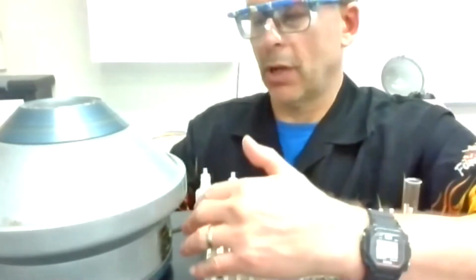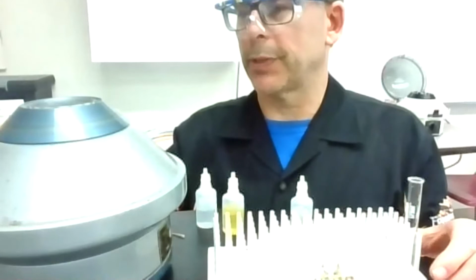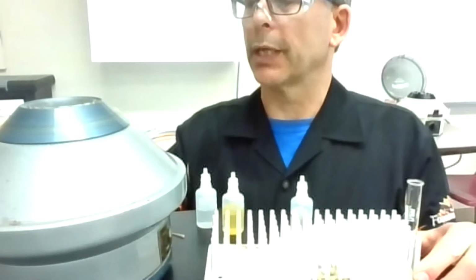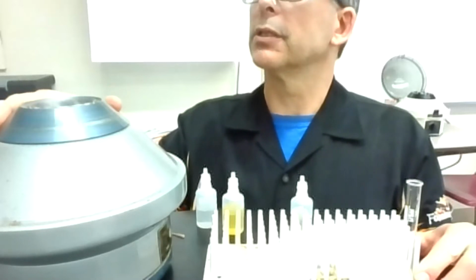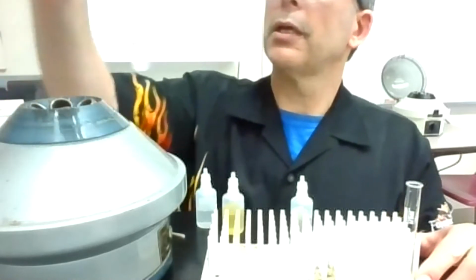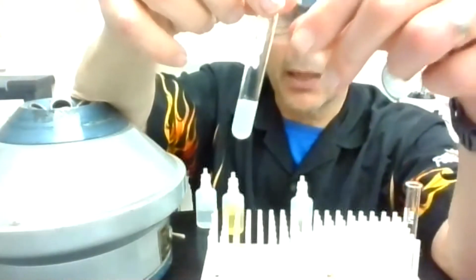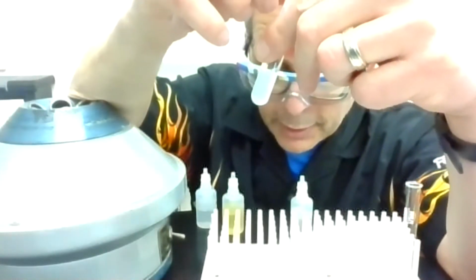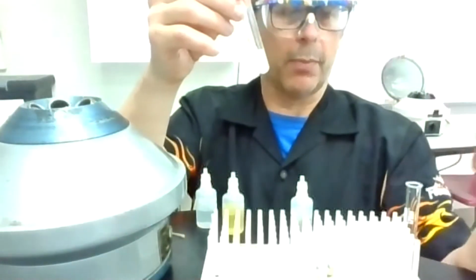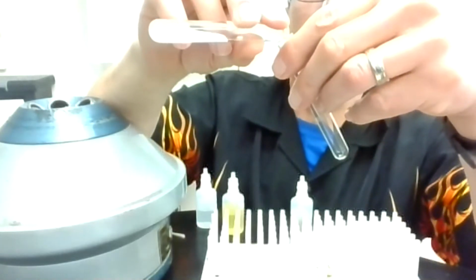So hopefully that's long enough. Again, usually those precipitate very well, or it separates pretty well. Sometimes I have to remix and recentrifuge if it doesn't do that great of a job. Okay, so I'm going to find this here, and I see some haziness, and I see some solid at the bottom. You know what? I'm going to maybe try that one more time. And what I'm going to do is just put the haze in a different test tube.